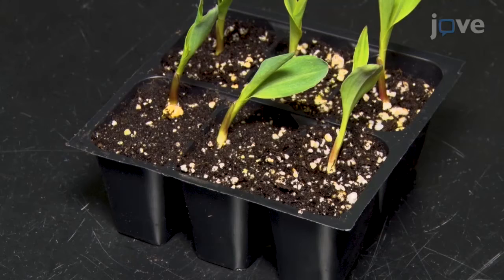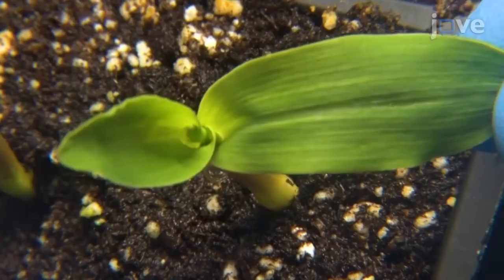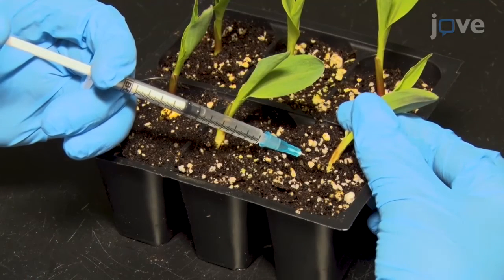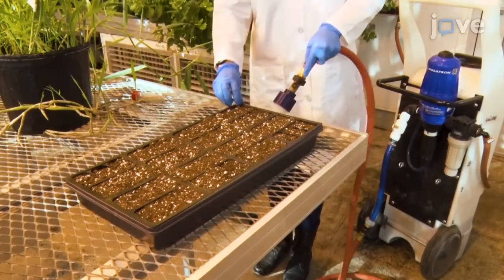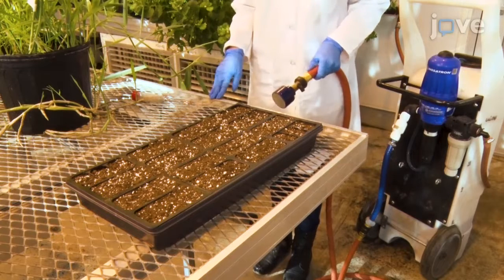This protocol allows the inoculation of viral vectors directly into maize plants that can be readily applied in most lab settings without the need for any expensive specialized equipment. Direct inoculation eliminates the use of an alternative host as an inoculum source, saving both time and resources. This method could be applied to additional viral vectors, maize lines, and potentially other monocot species.